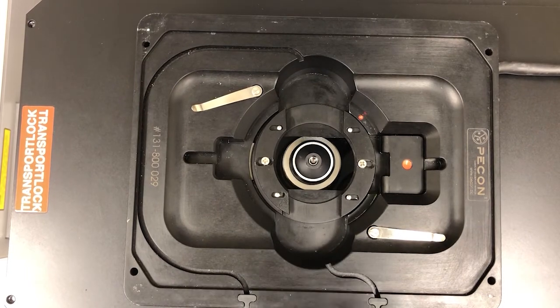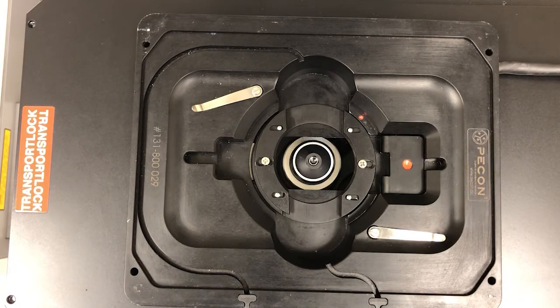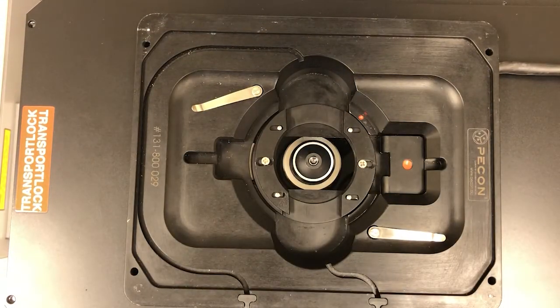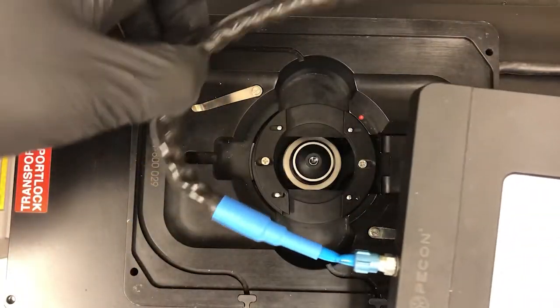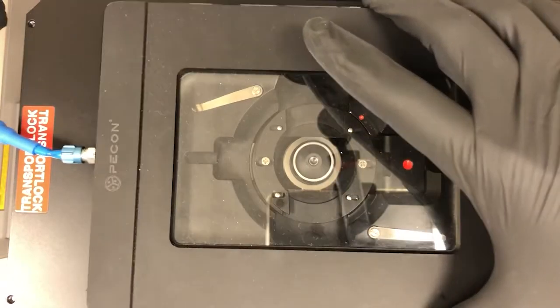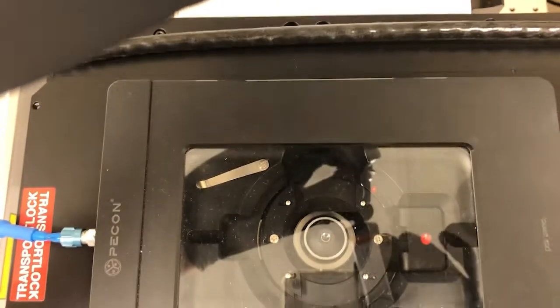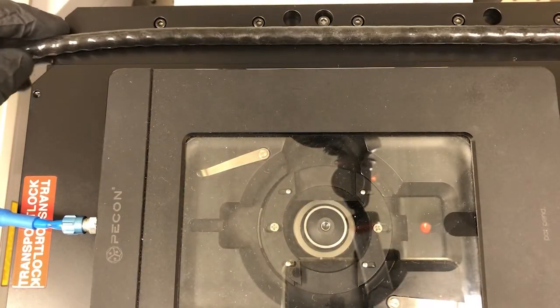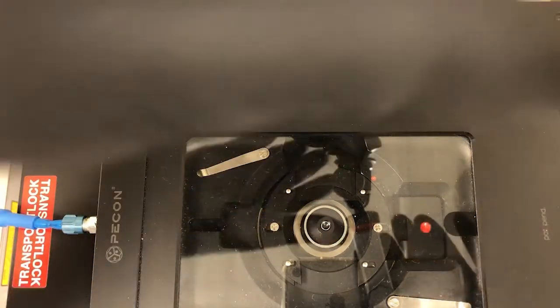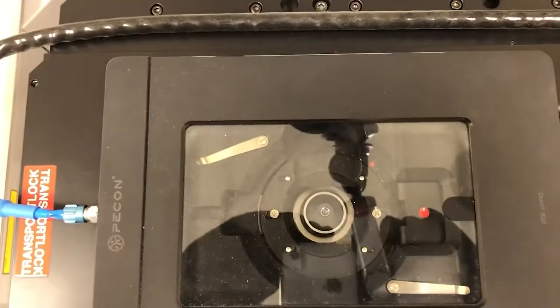Once we put on the sample, we're then going to put on the lid. So you can see the lid has sort of two cables, this thick one and this thin one. Usually the way I put it in position is I put the thick one kind of in a loop, because what that allows me to do is to place it, let me see if I can point this here. I can lay that sort of thick and kind of heavy cable there, whereas the other cable is just hanging off the side.